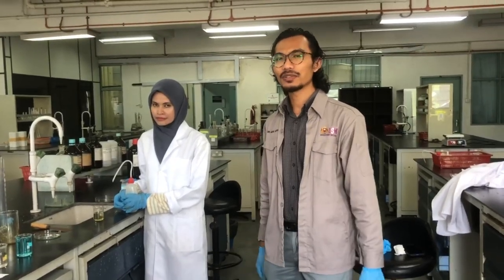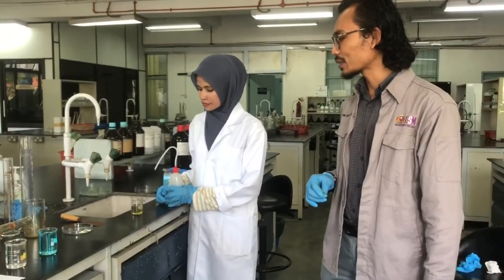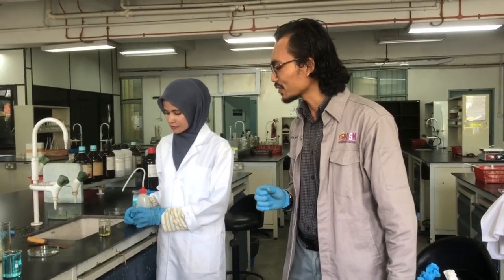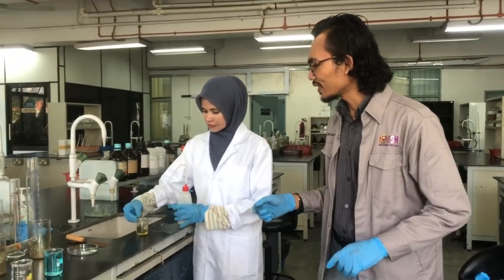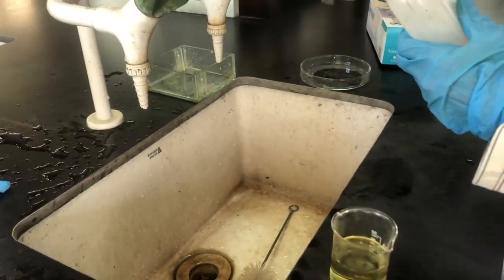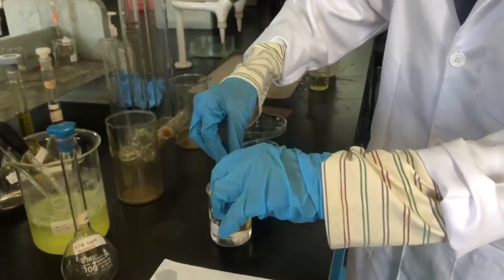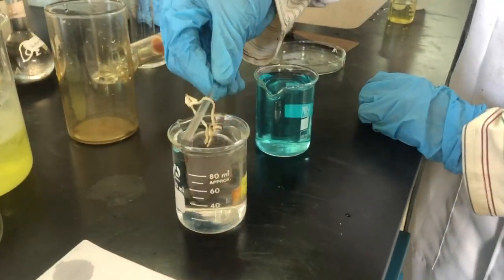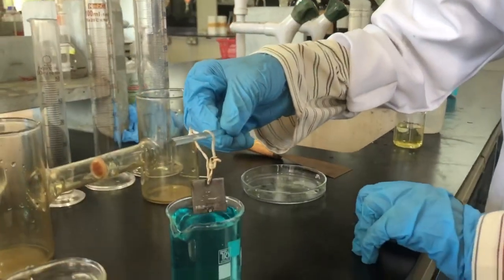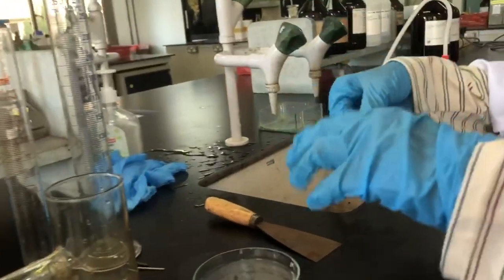Welcome back. We are moving on to Experiment D — corrosion protection by means of passive layer. If you remember, we dipped a small plate in nitric acid solution earlier. We now remove it, rinse thoroughly with distilled water, then dip first in distilled water for a few seconds. We observe the surface — it looks quite shiny — then dip into copper sulfate solution for a few seconds and remove. There are not many visible changes at this point.